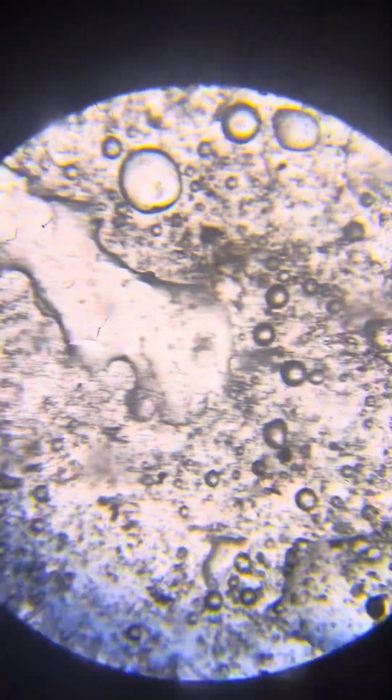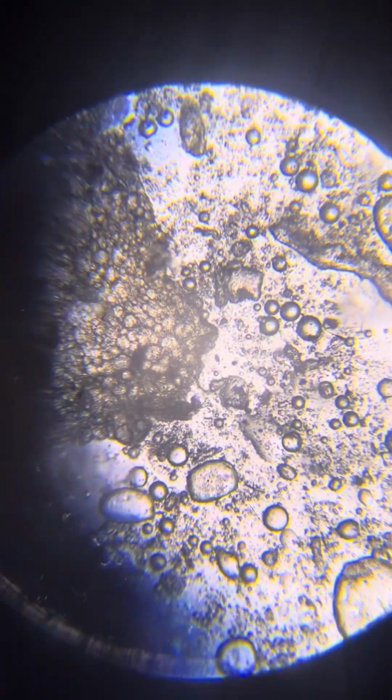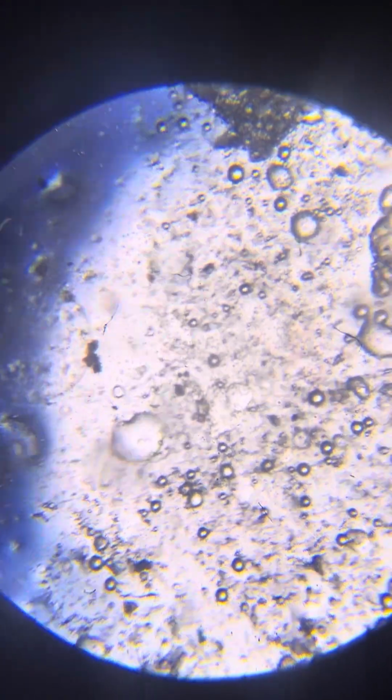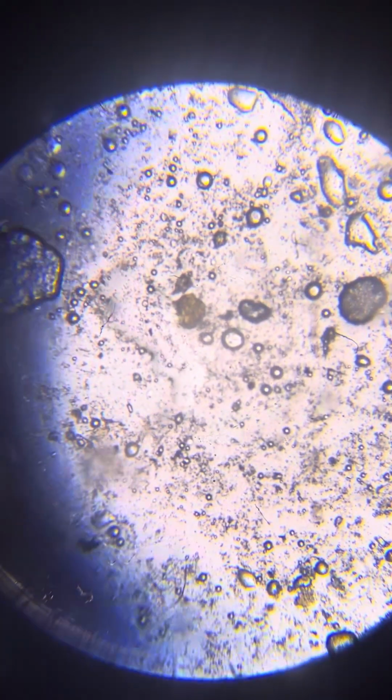Not that different from the other one. We don't see many dots because, actually I don't know why. Maybe we do see dots. I would say we see a tremendous amount, more than we saw in the previous slide, which is in line with what I described, but they actually don't look like dots. Most often they look like pretty much cooked.